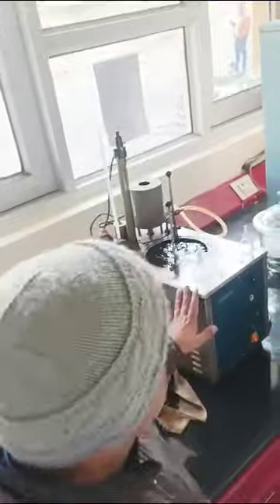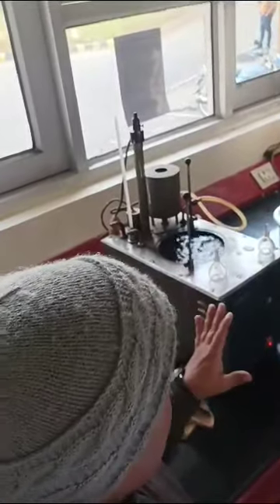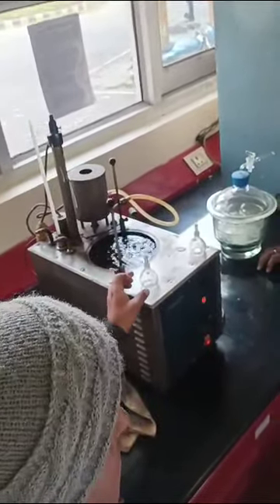sample. Then after filling the water, keep it here at 30 degrees, 35 degrees, whatever you want, and let it sit until there is no gap inside the water, and the excess amount of the water should splash out from this. You can see the extra amount of the sample is coming out, because at temperature obviously the volume will expand, so it will cover the whole area of the bottle.